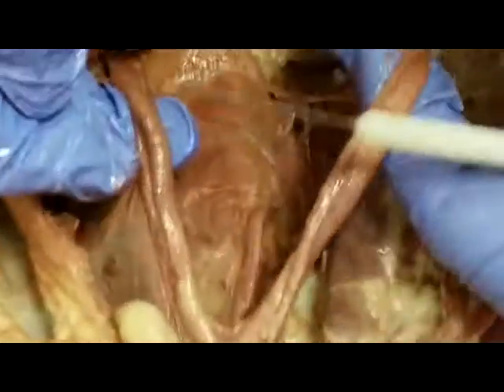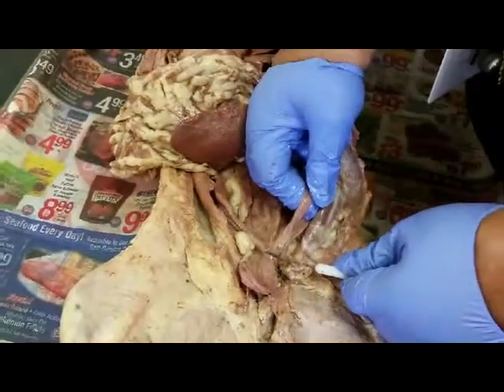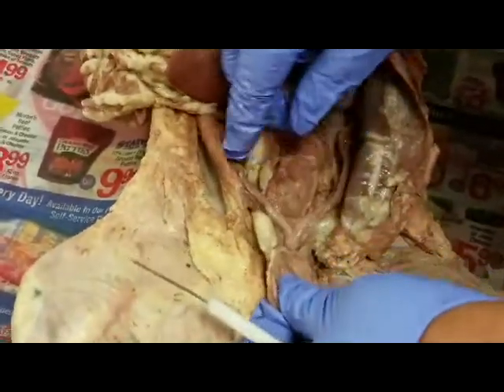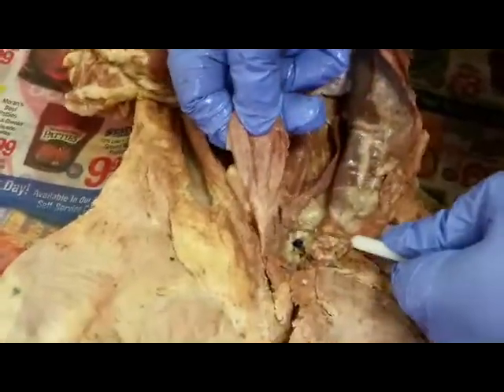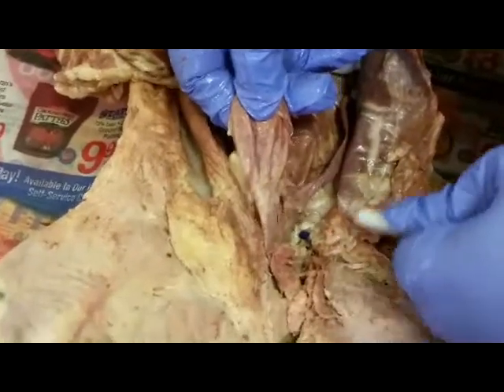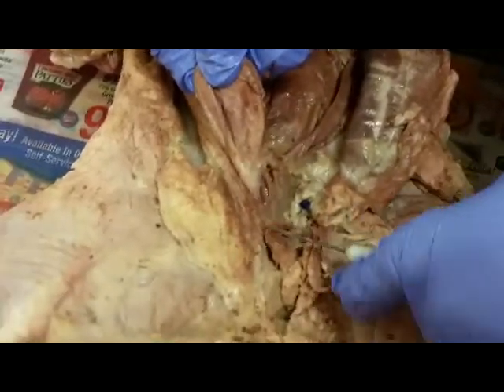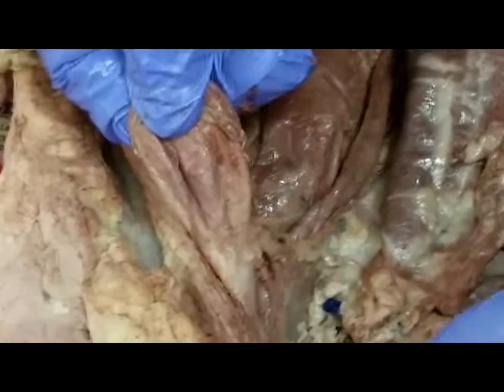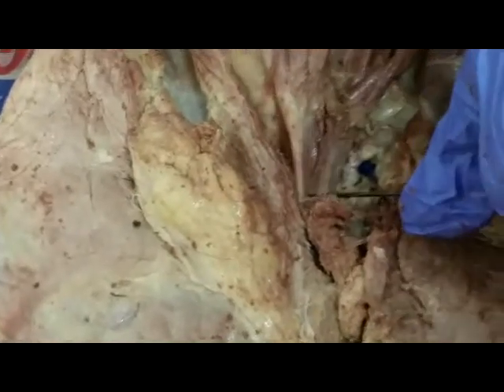So these are the uterine horns, and the uterine horns end right there, which is the uterus, the body of the uterus. And now here is the urethra, and where the urethra leaves the urinary bladder and joins right below the uterus, where I'm pulling out, this would be where the pin is now, is going to be the vagina.